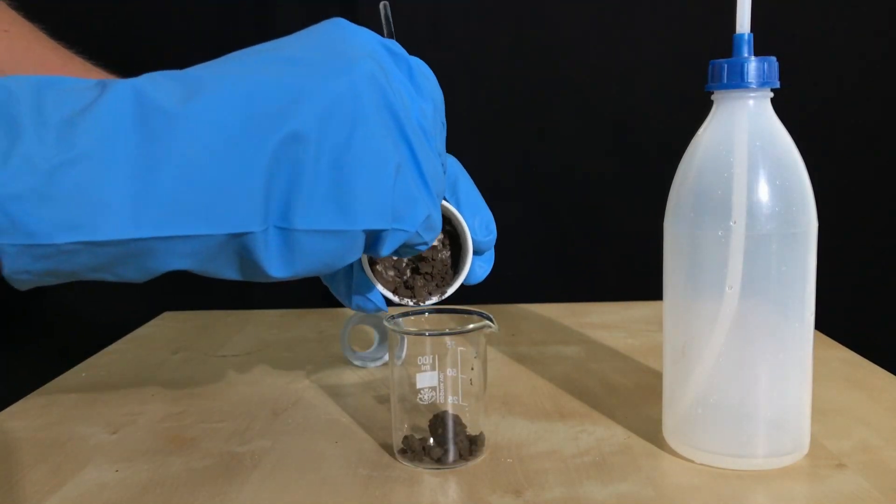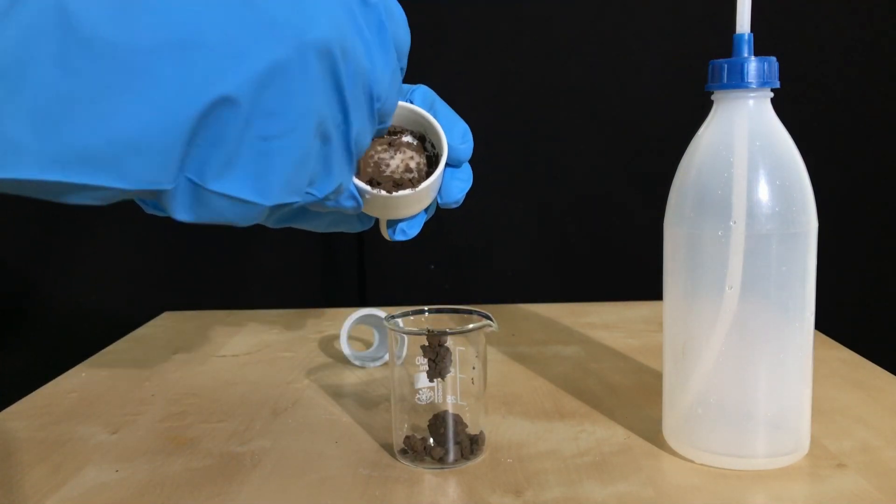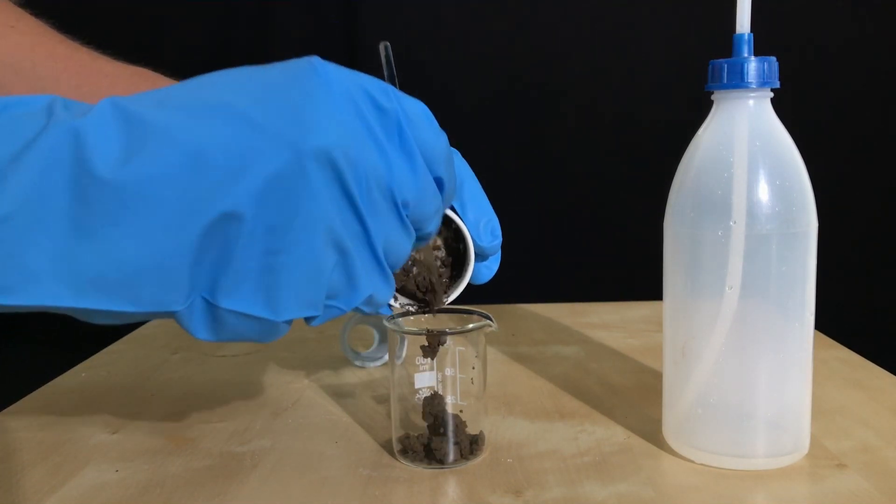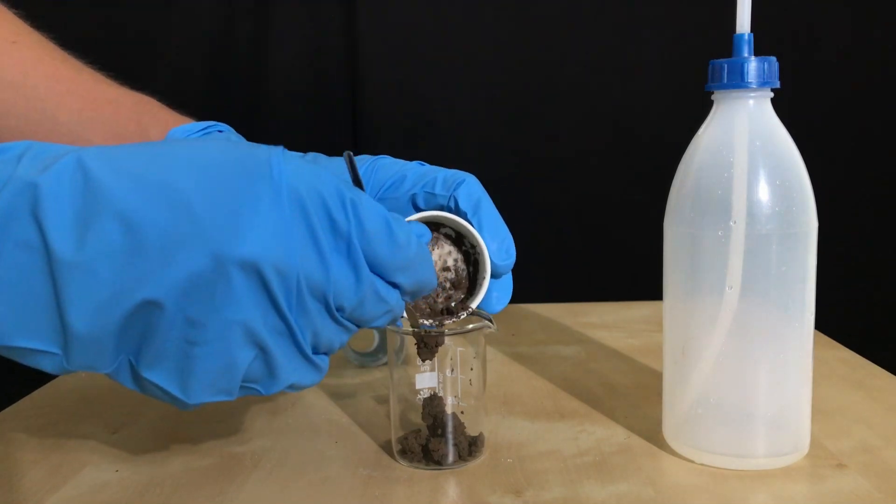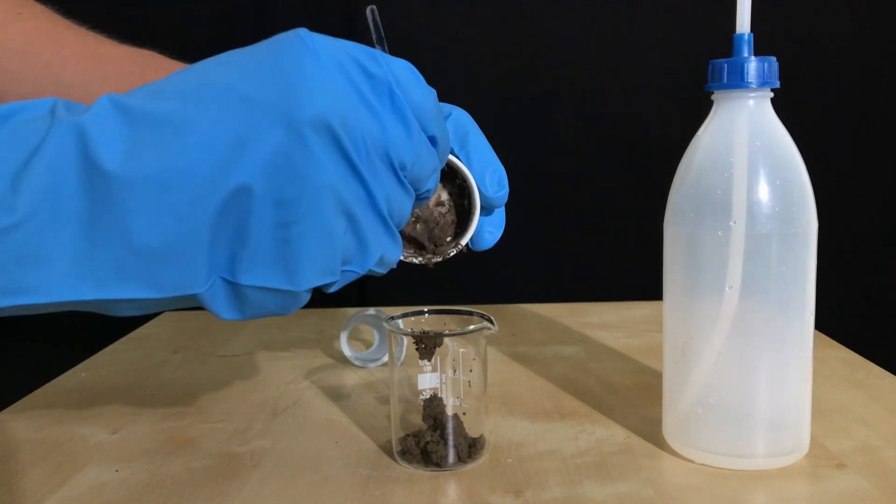Of course silver oxide is still somewhat valuable and therefore I tried to scratch as much of it out of the filtration funnel. The silver oxide is still slightly damp, so it will have to be dried.